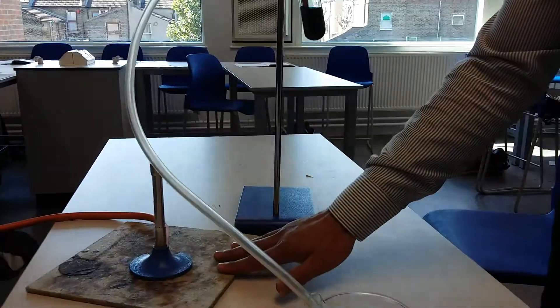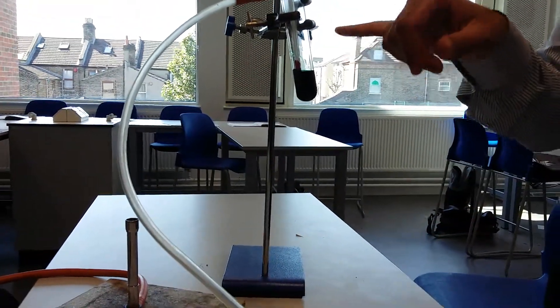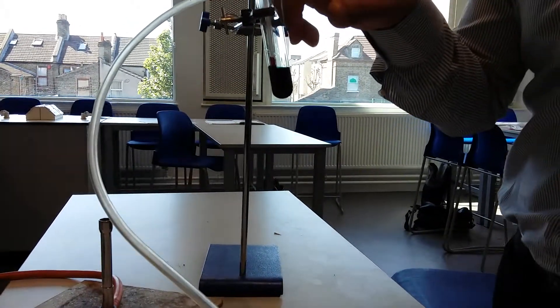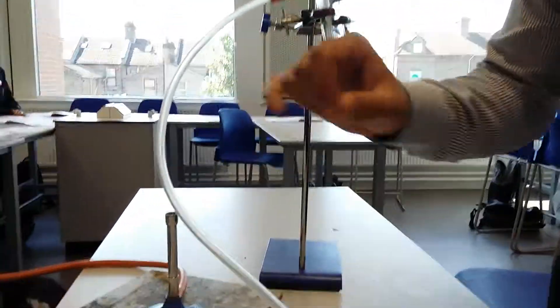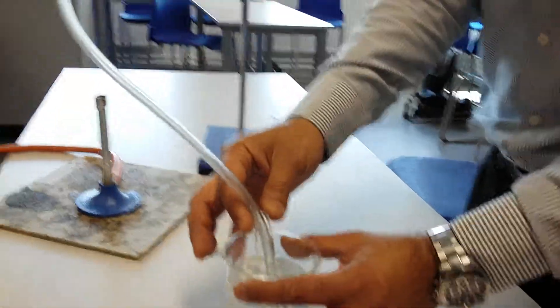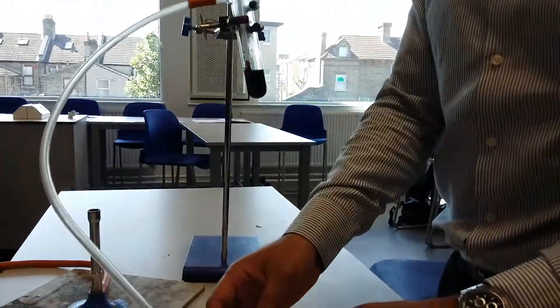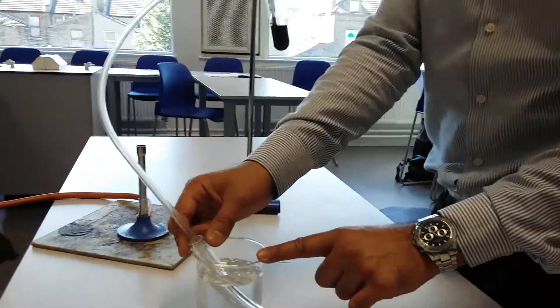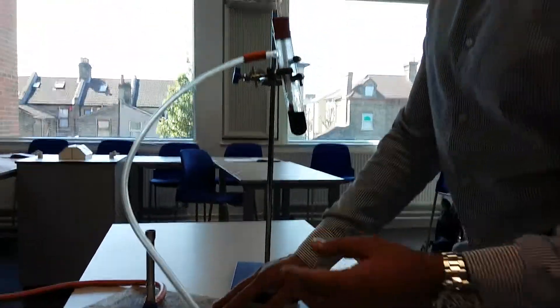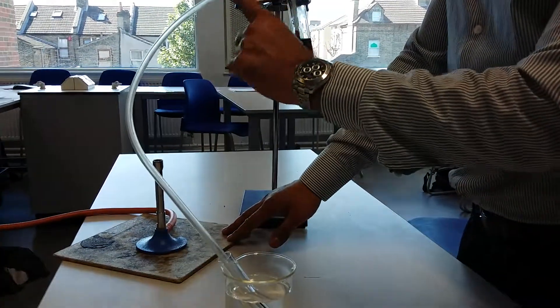And it's reached its first boiling point there so some of it has started to turn into gas. And it's going to end up going through my tube over here. I've got a very cold beaker of water over here. And my whole pipe is actually very cold.